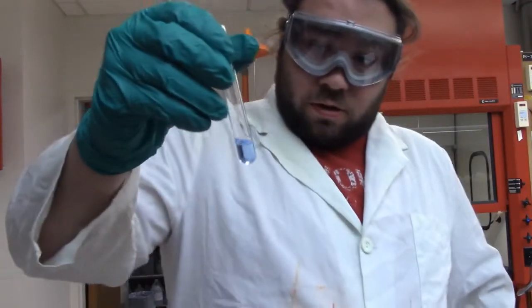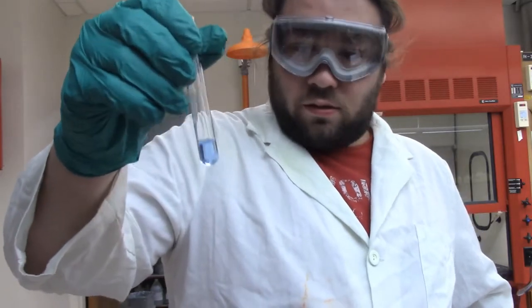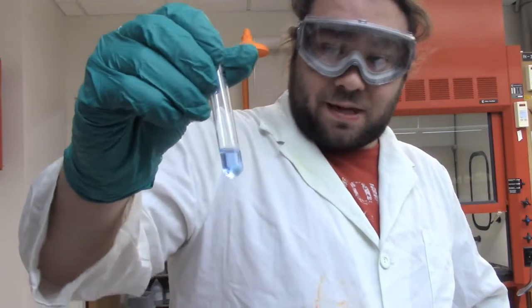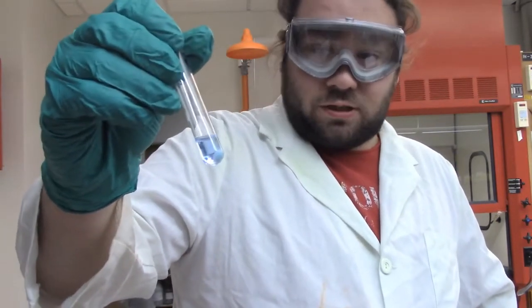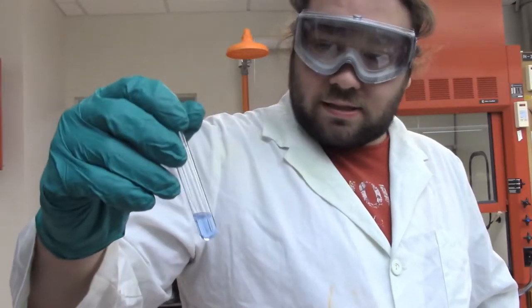Alright, so I went through the next steps, and at the end of all that, we have ended up with a light blue solution with a bit of a precipitate at the bottom. It looks blue because of the blue solution, but that is a white precipitate. So once again, you guys tell me, do we have bismuth or not? And with that, that is the end of our group 2s.